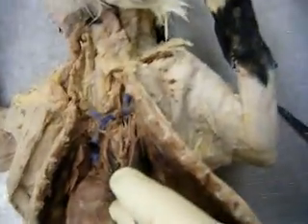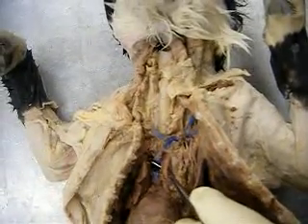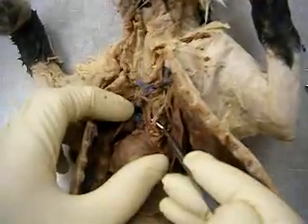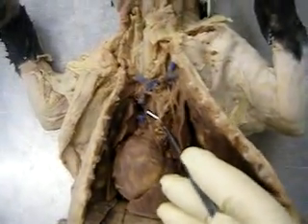Okay, so again, if you look at the diagram up there, you see on the right side of the cat, the brachiocephalic, you see how that part feeds the arm and head? Whereas on the left side of the cat, that artery system, starting with the subclavian, only feeds the arm. Can you guys see that? So that's how you can remember what side the brachiocephalic's on, on the arteries.